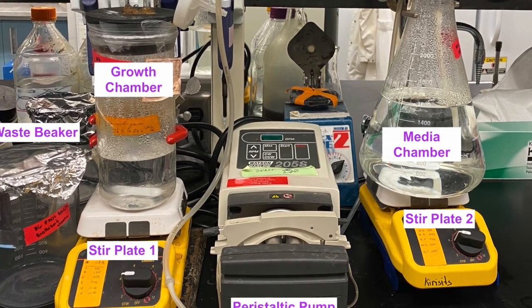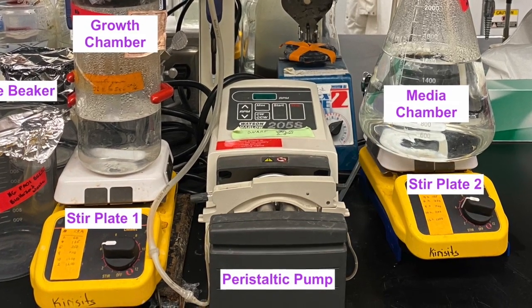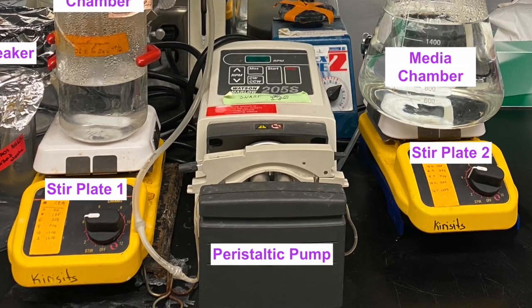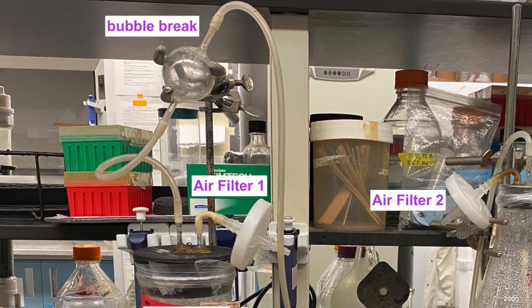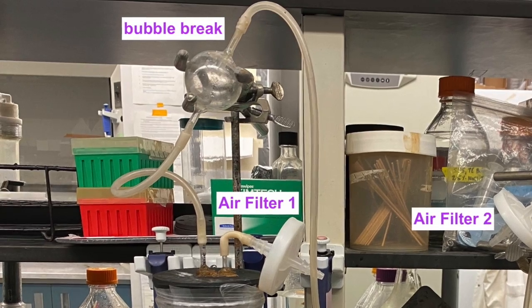Both the growth chamber and the media chamber sit on top of stir plates. This ensures that the concentration inside both of these chambers is homogeneous and uniform. There is a bubble break above the growth chamber to ensure that there is no backflow out of the growth chamber and into the media chamber. The flow is one way from the media into the growth.